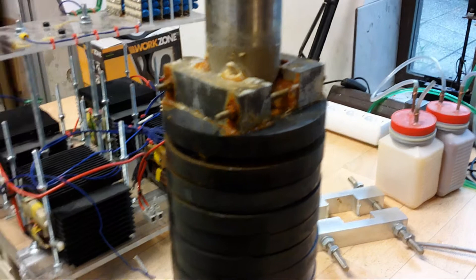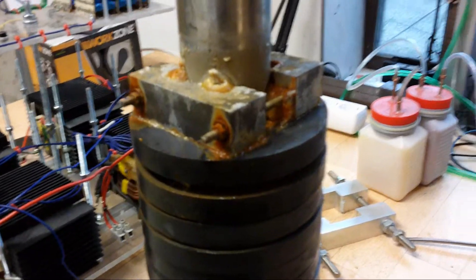I think I will just put it in hot water to kill everything that's on it and then clean it up. I don't know how yet, but we'll find a way.